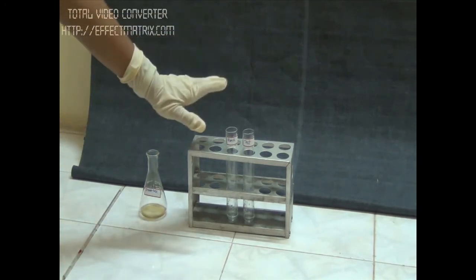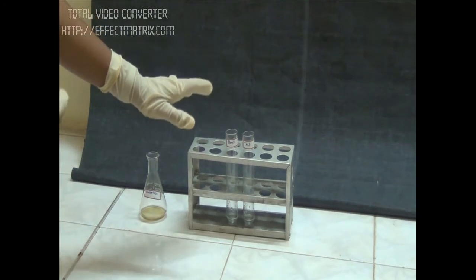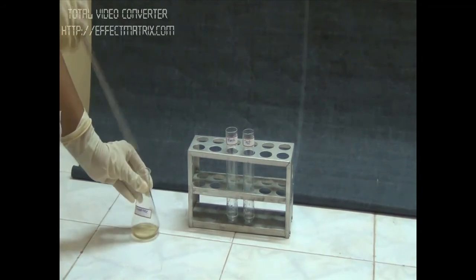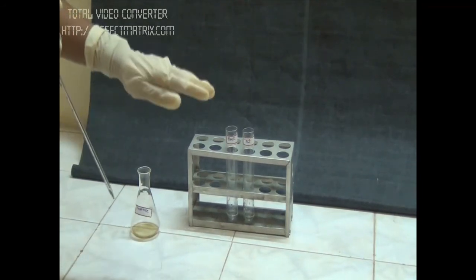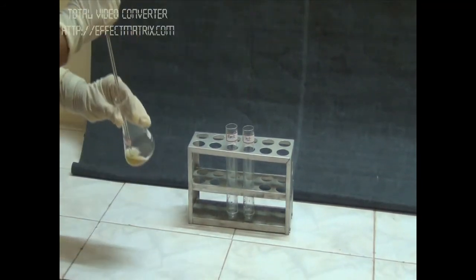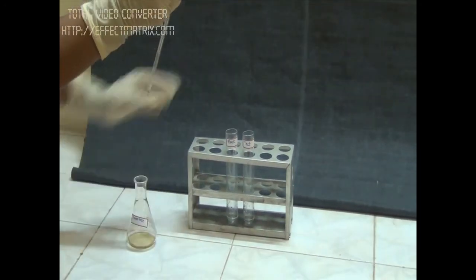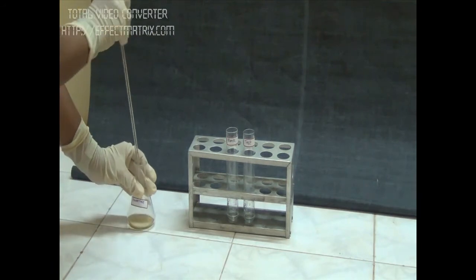Now all desired reactions in the test tube are complete. We add 0.25 ml of enzyme to the blank so that the volumes in both tubes are equal.